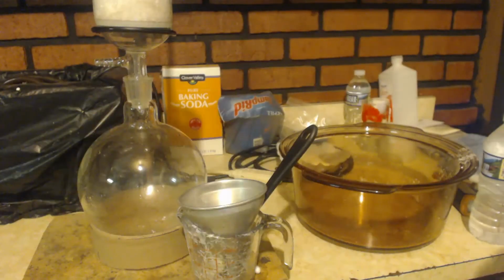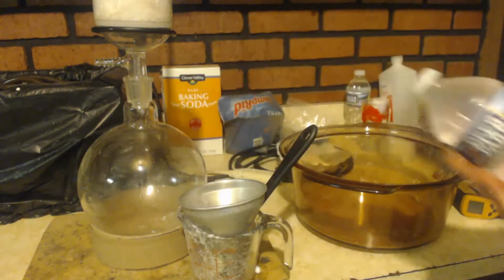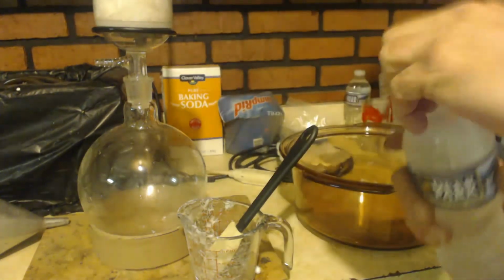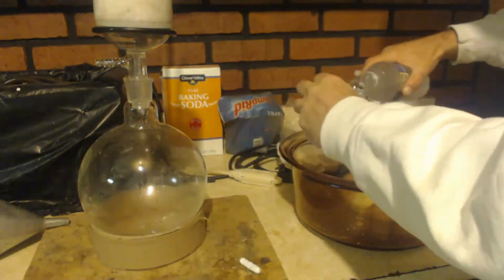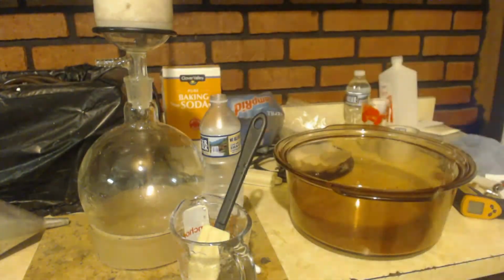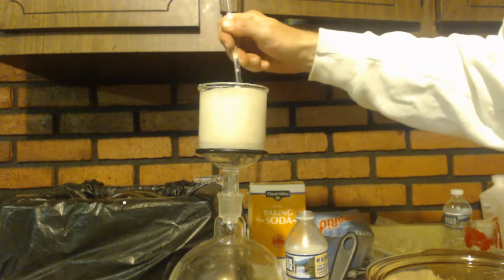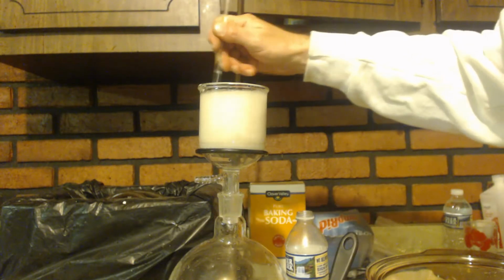So that's all the crystals there. You can see that nice and white. There's no dark tint to any of the crystals or anything like that. It's all nice and clear and white. You can see down there there's a yellow tint to the water. So I got some ice cold water. I'm going to try to get some of the stuff out of here and then wash this. And then I'm going to stir this up while I do this. Get anything that's in the middle. You can see it's kind of brownish in the middle there.